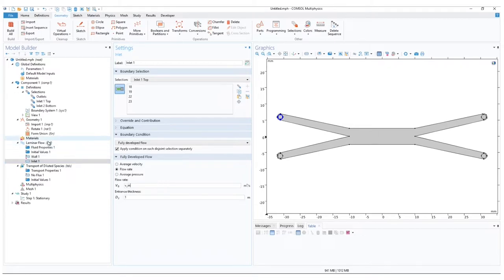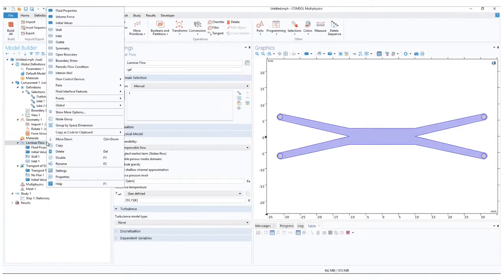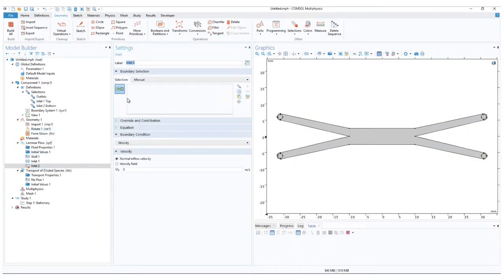Because we have another inlet, let us add a second. Likewise, select the boundary to be the inlet bottom. Change the boundary condition to fully developed flow. And set the flow rate equal to the first.